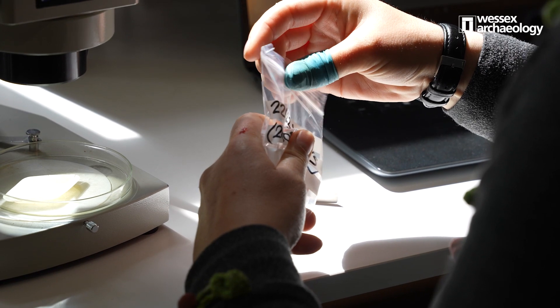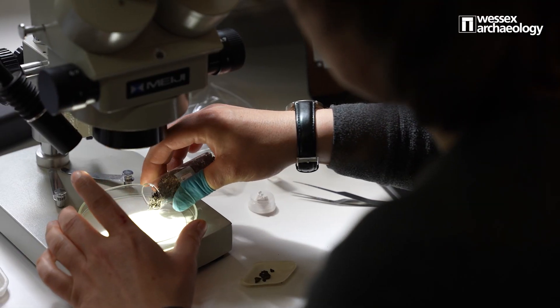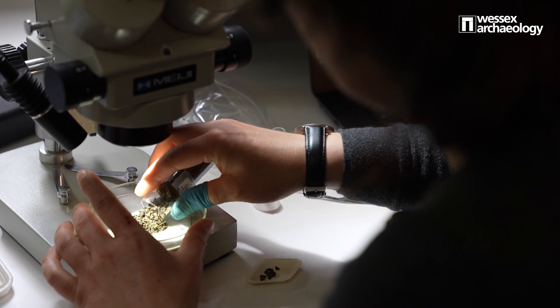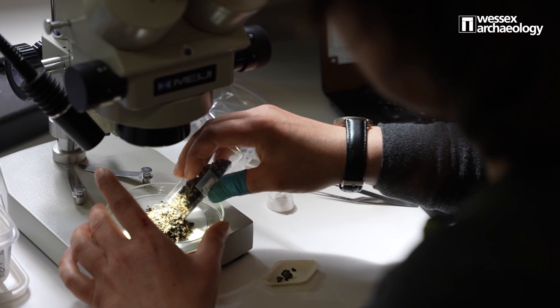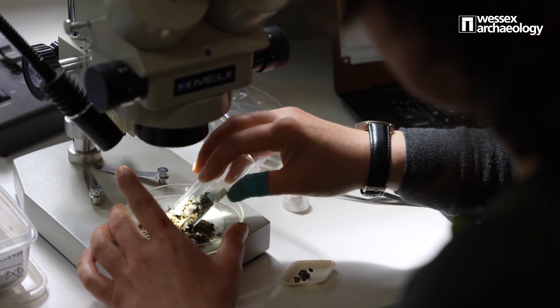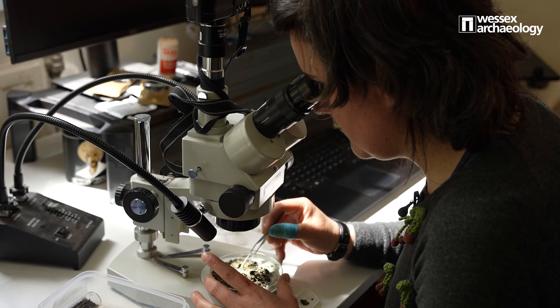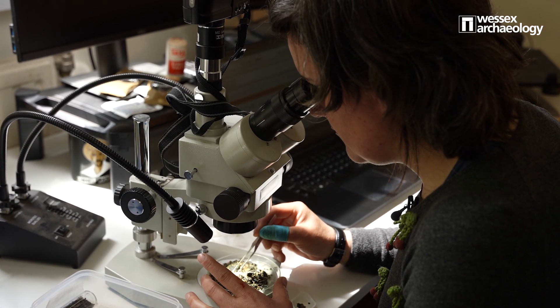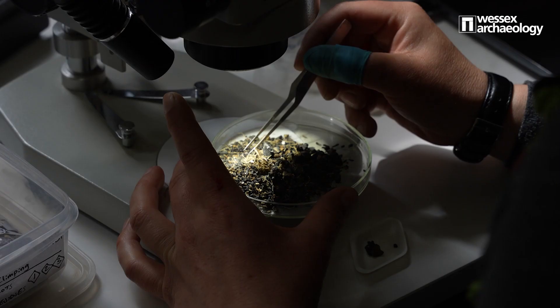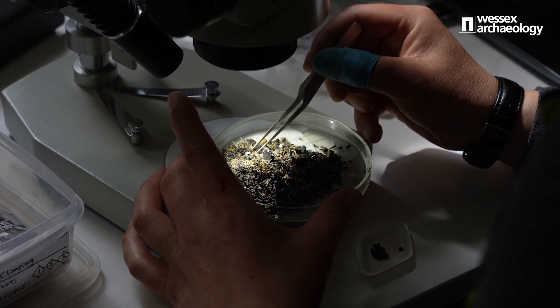We put the flots and the residues under the microscope to scan the environmental evidence we extracted, for assessment purposes and also for analysis purposes and quantification. Basically, what the microscope allows us to do is to identify the environmental evidence — it could be plant remains, insect remains, small animal remains — and then it allows us to compare it with other reference material that we may have in our reference collection. We can make observations on the structure and the anatomy, so it's basically for identification.